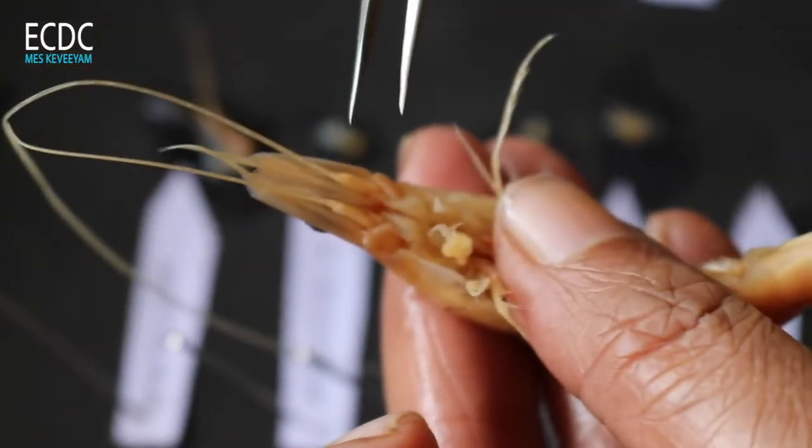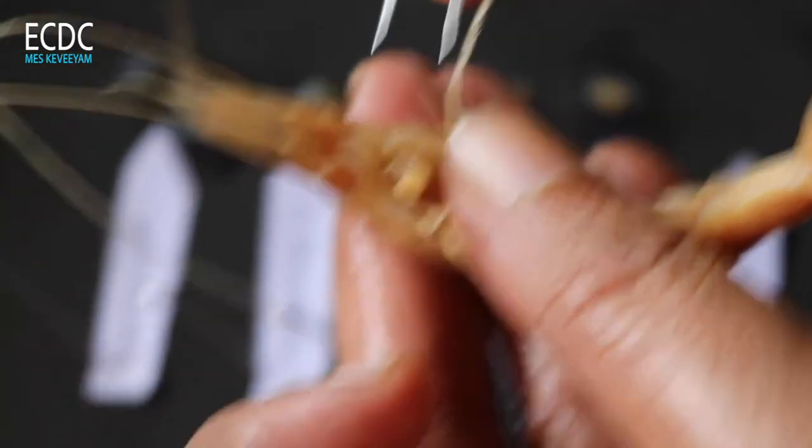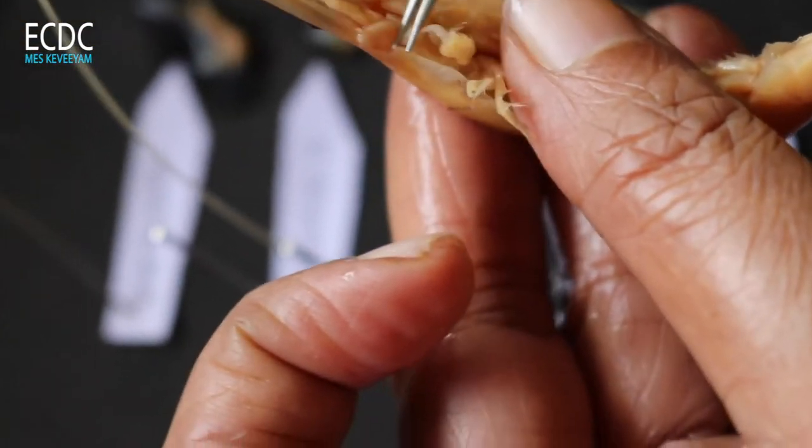These are the thoracic appendages. This is the maxillipedes.